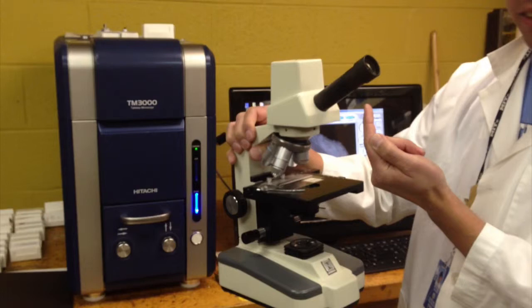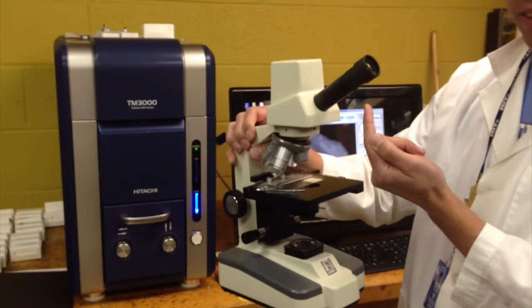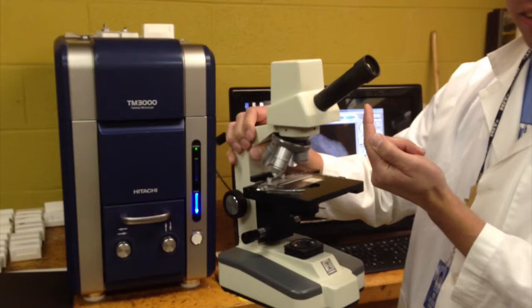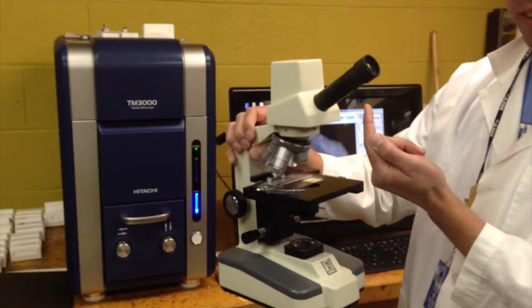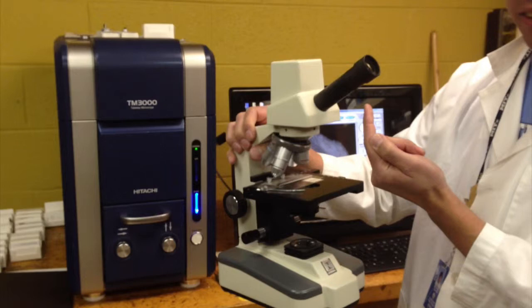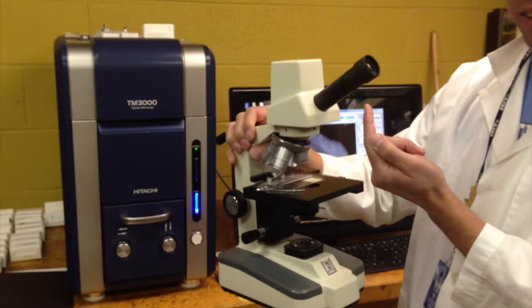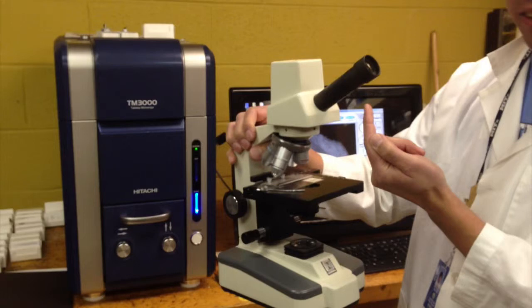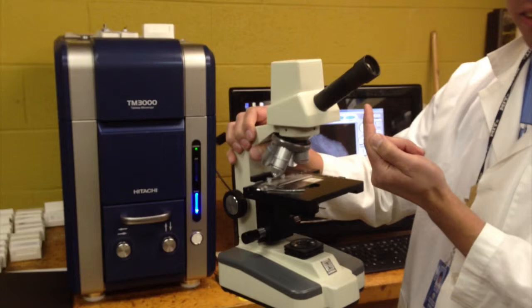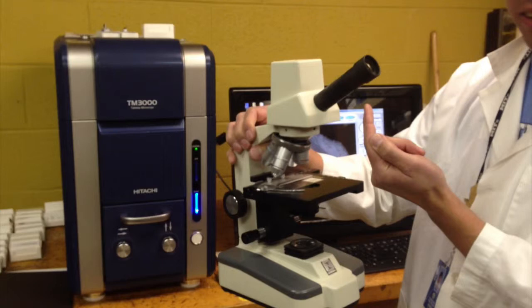With an electron microscope, we need to measure things that are smaller than light. Hard to imagine, but things can be smaller than light. And so this machine — the scanning electron microscope — uses electrons to analyze, not light. Inside here we have something called an electron gun that fires a 15,000 volt beam down through a series of lenses. But they're not glass lenses — they're electromagnetic lenses that control the position of the electron inside this chamber.